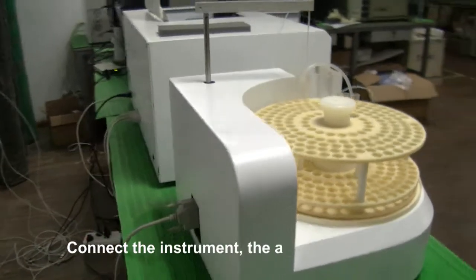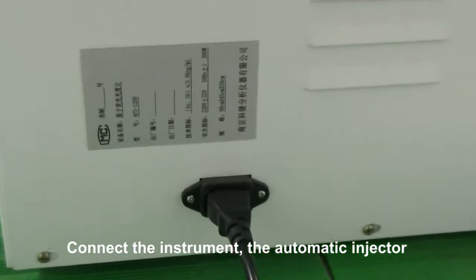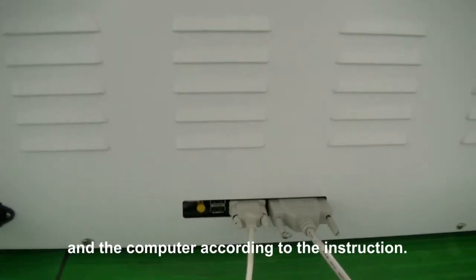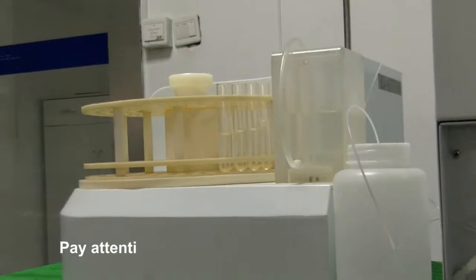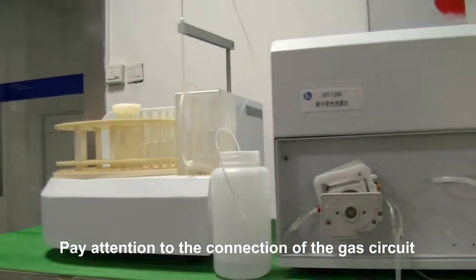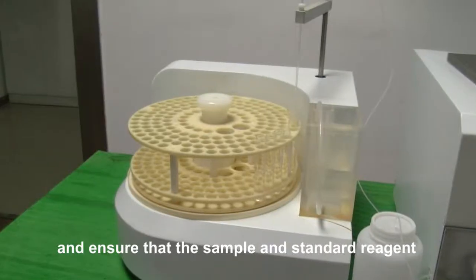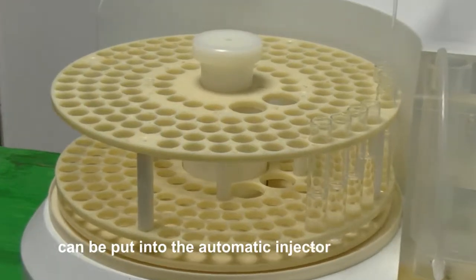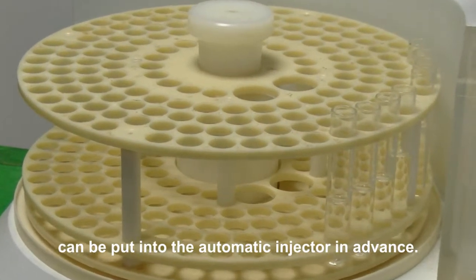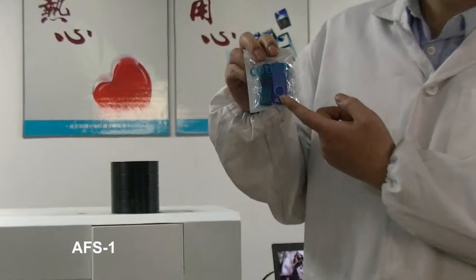Test Operation Procedure Step 1: Assemble the instrument, the automatic injector, and the computer according to the instruction. Pay attention to the connection of the gas circuits, and ensure that the sample and standard reagent are loaded into the automatic injector in advance.